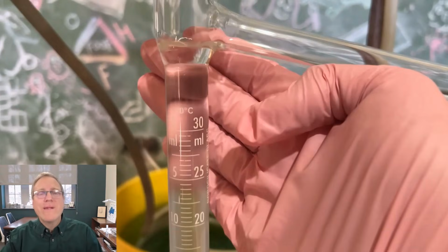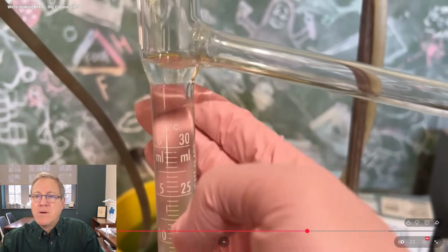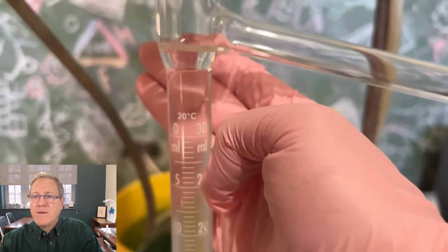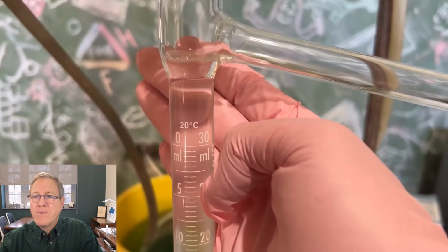No more water forming, no more reaction progress. Time to stop it. Quite often, but now, sorry, it's quite hot. I've got to stop touching that. Yeah, you can see one tiny droplet. So, we could keep going forever and there'd probably still be little drops of water, but very, very few drops of water coming over now.